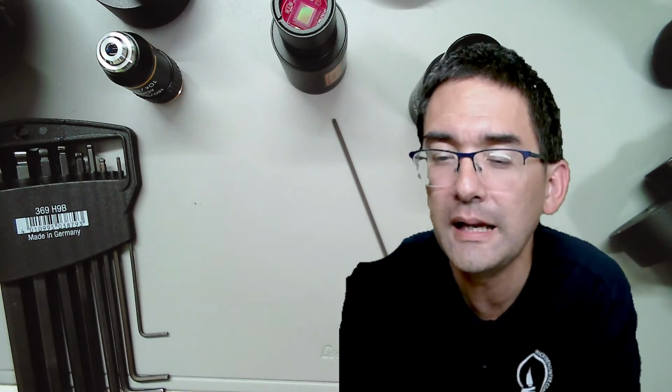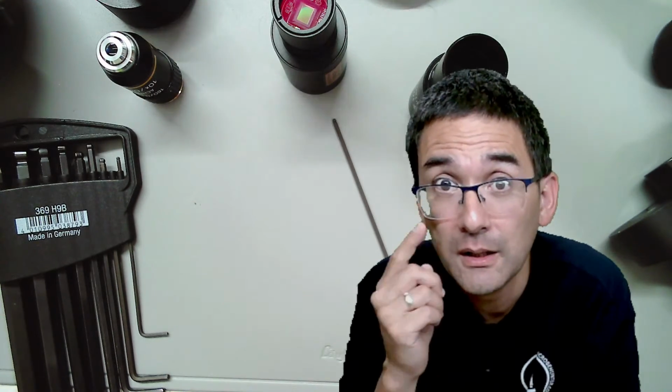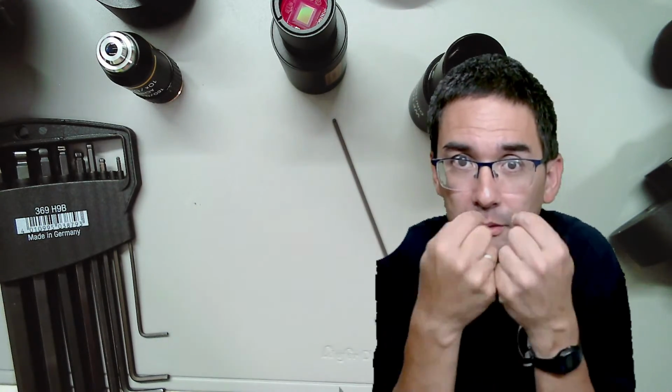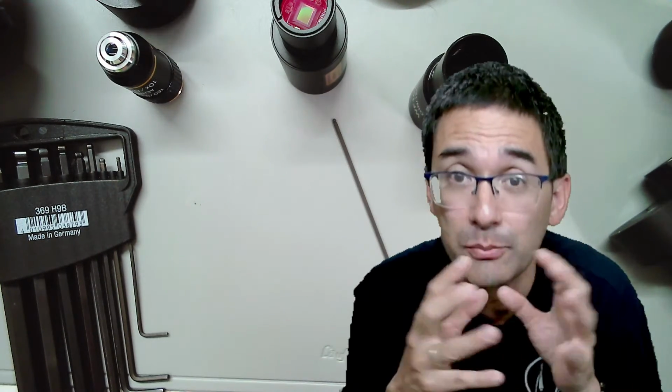I tried it with an endoscope cam, very small picture. Endoscope cameras sometimes have a lens in front, because you want to get a very wide angle. An endoscope goes into the digestive system, so you have to get a very wide angle, and if you try afocal photography with that, of course, you also get a very wide angle in a very small image. What am I trying to say here? Megapixels are not everything. There are so many other things to take into consideration.